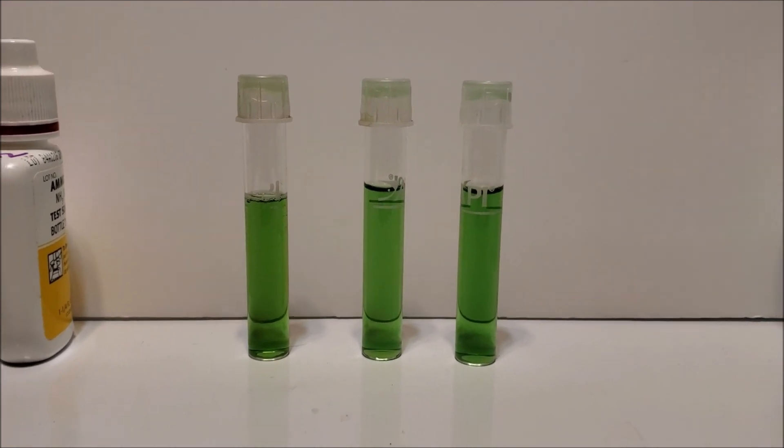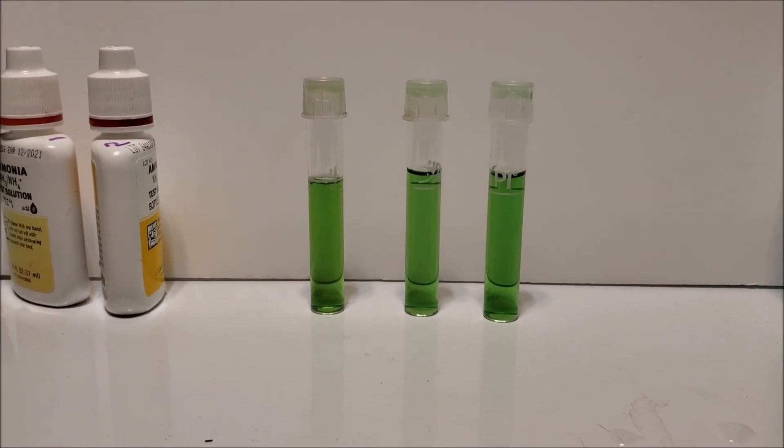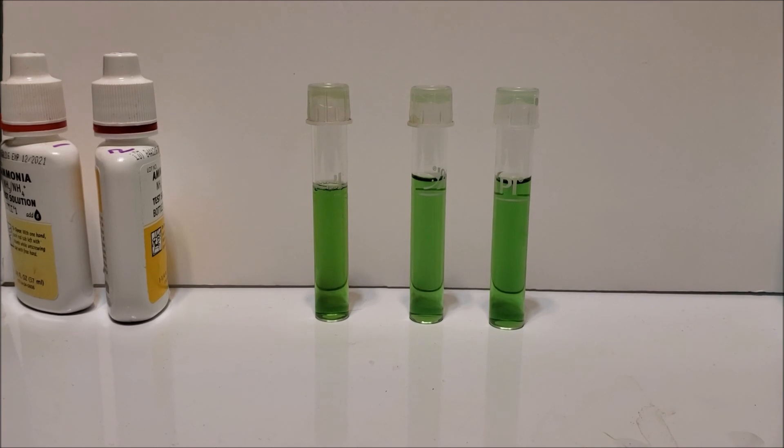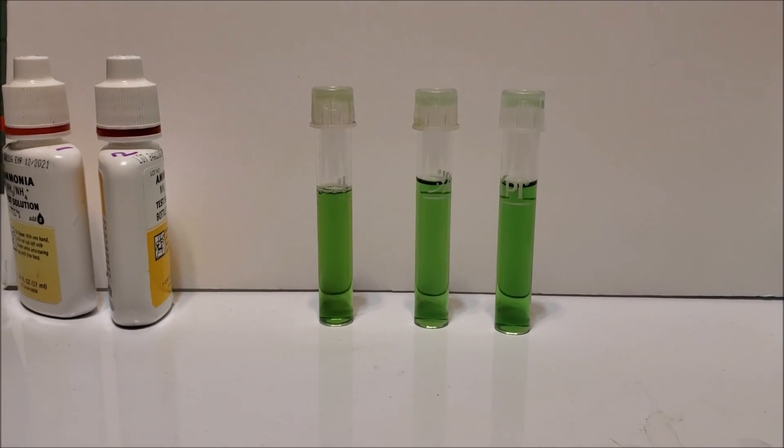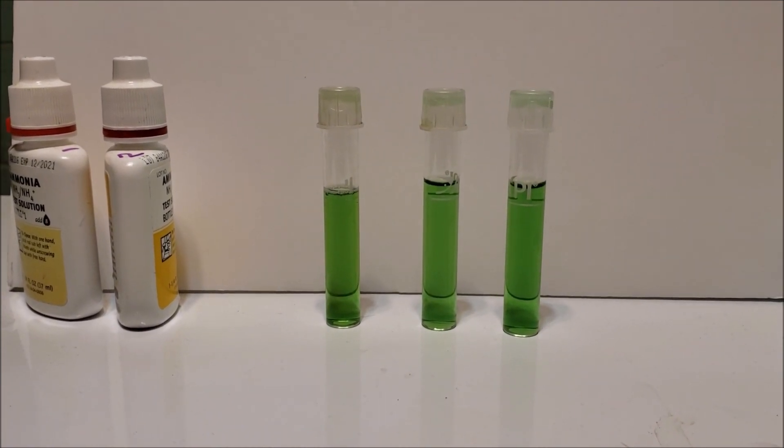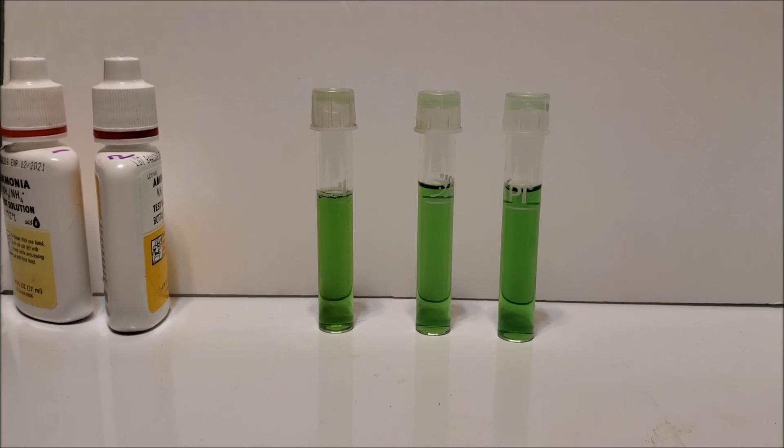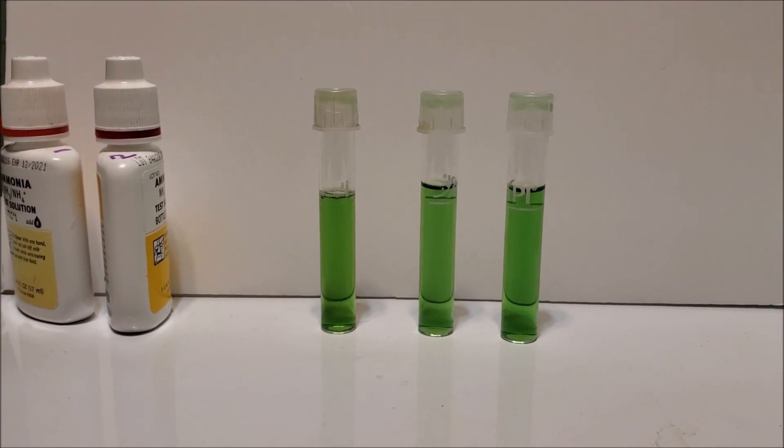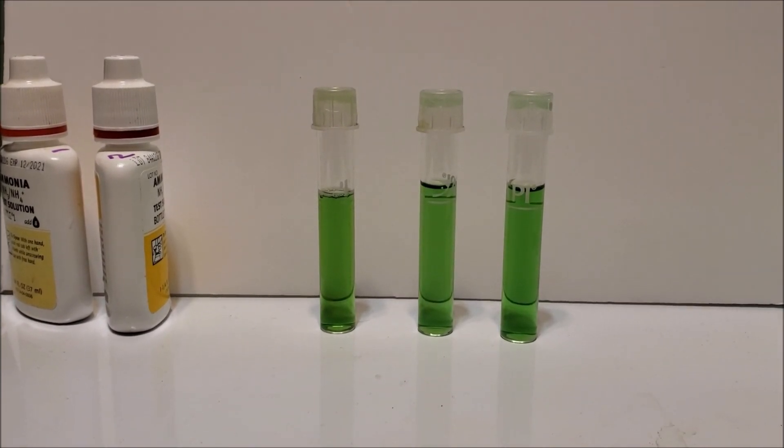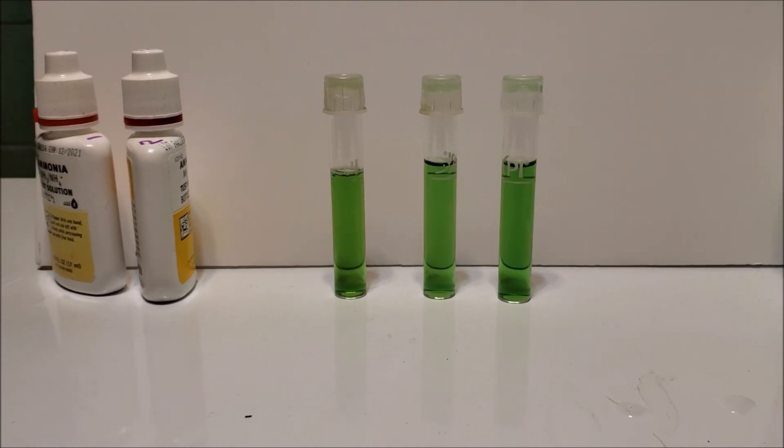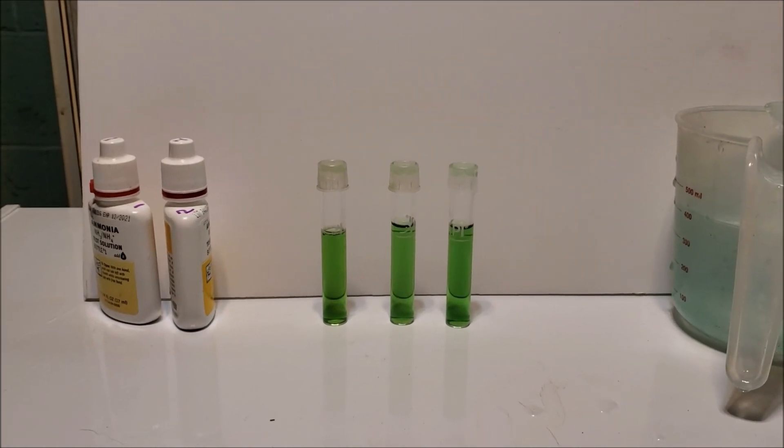So there you go. You know, they've got to put the instructions on the bottle on how to do it in some fashion. They can't just say mix it up any old way. I would be willing to bet if you did one drop of bottle number one and then one drop of bottle number two and then a second drop of bottle number one and the second drop of bottle number two, any combination of mixing those two reagents in there in equal parts will give you your reaction.